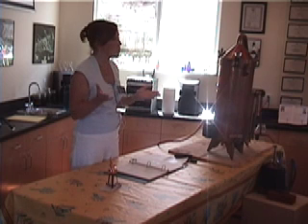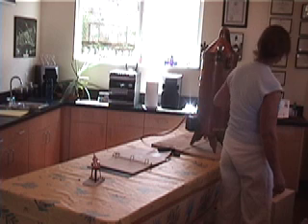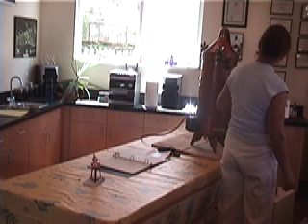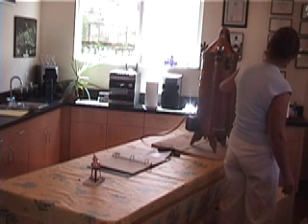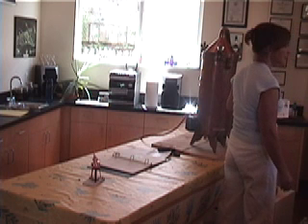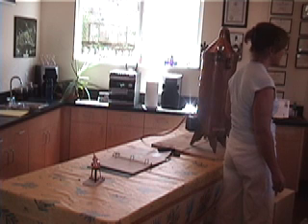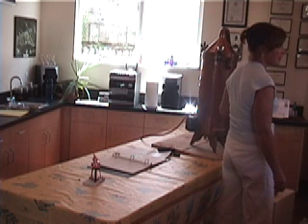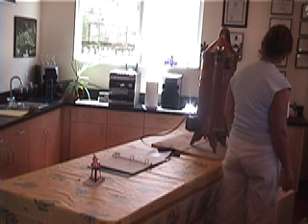You can also use it in cooking — in cookies, for example. The temperature is going to start at zero, and we want it up to about 200, though it probably won't go much beyond that. Usually it will start coming over at about 150, so the temperature has to be at least 150. There's no pressure on the system — it's a low-pressure distillation.